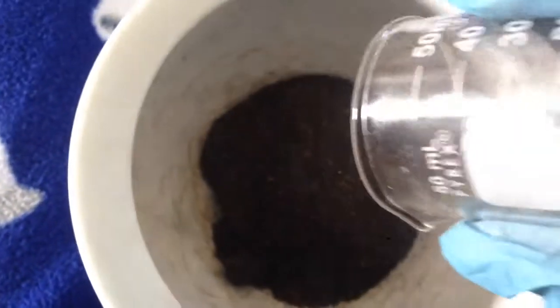Let's measure it all out. As you can see here, we have a total of 40 grams. I then transferred all of the black powder into a mortar to crush it with a pestle. Because on the second hand warmer, it actually started to clump up.